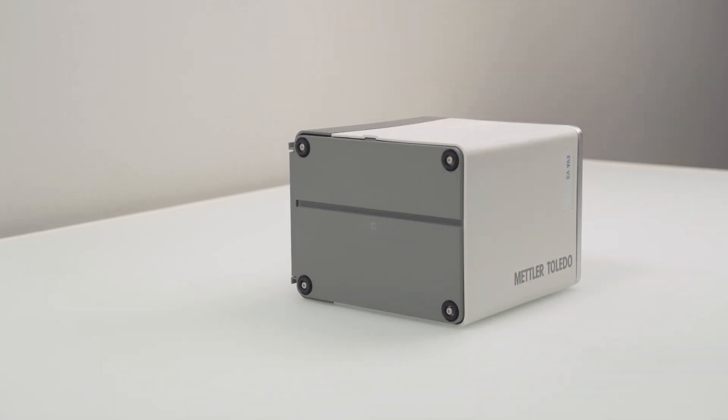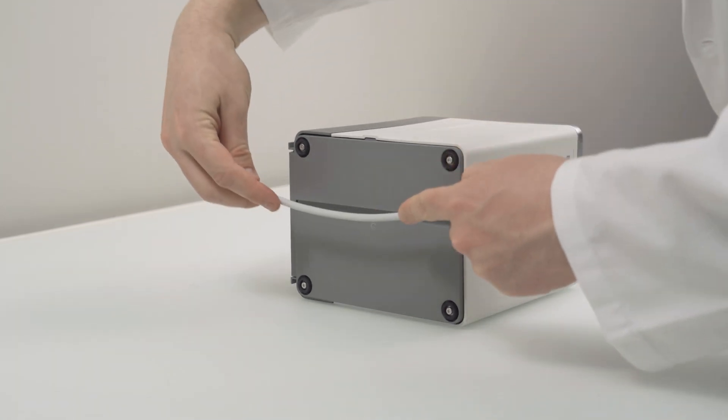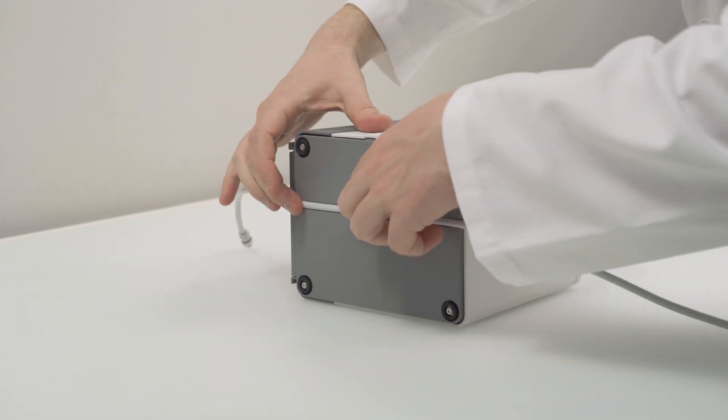Then lay it to the side. Put the terminal cable into the cable duct and turn it back onto its feet.